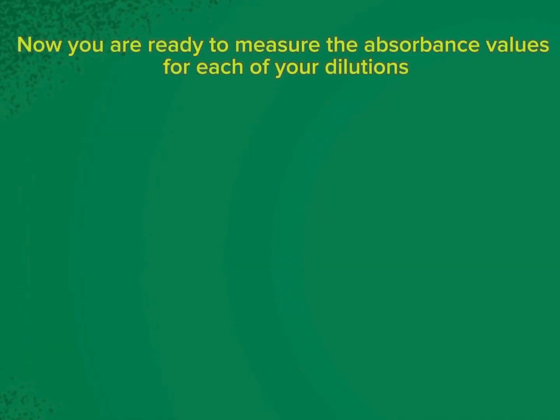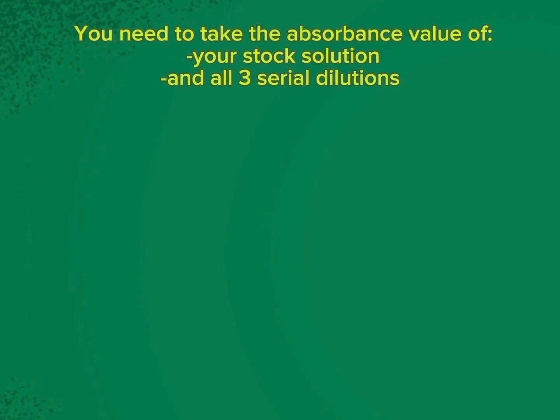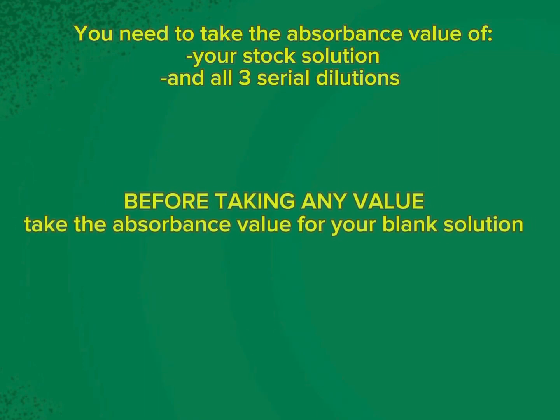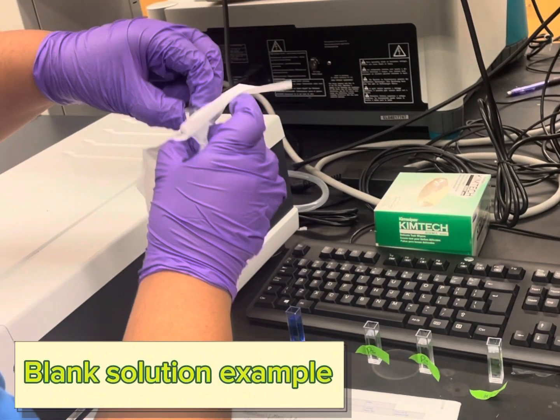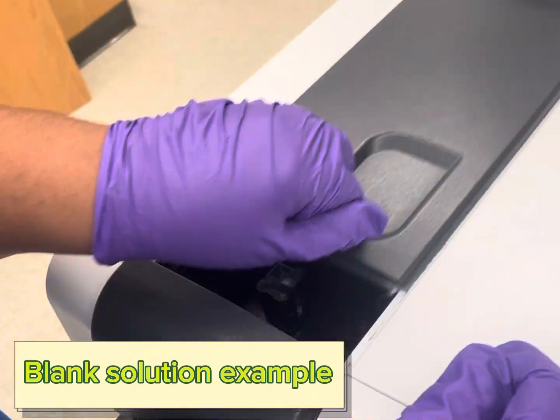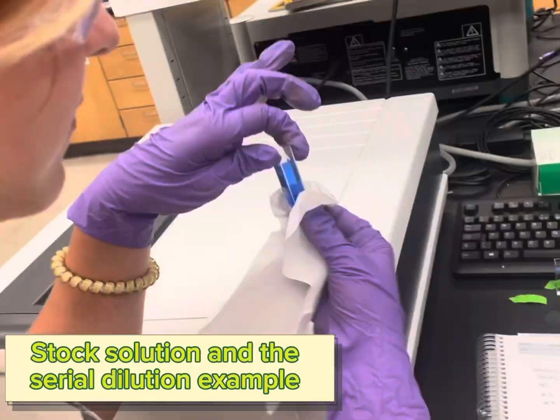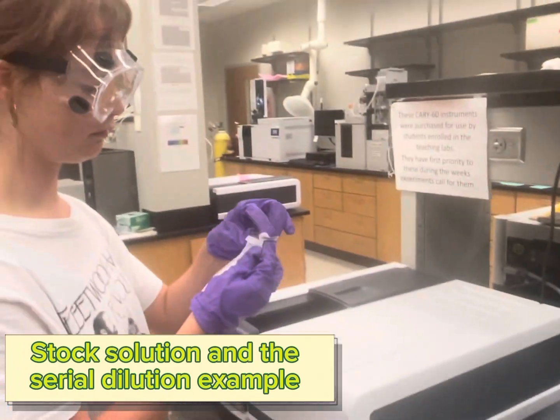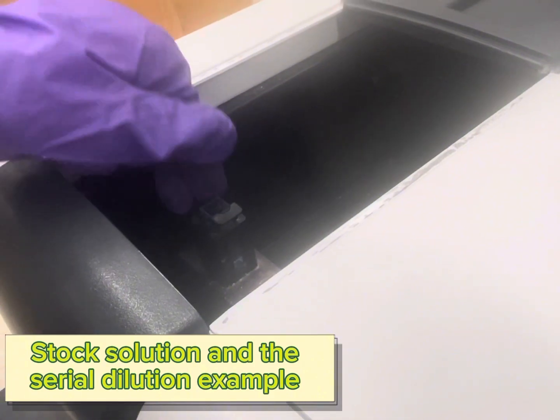Now you are ready to actually measure the absorbance values of each solution. To do this, you use a different program, but you use the exact same steps as before. Don't forget you need to take the absorbance value of your stock solution as well as your dilutions, and before everything else, test your blank solution as a reference. Be sure to set your wavelength to your lambda max and follow the exact same steps as before, with wiping down your cuvette, opening the machine, and closing the machine. Again, repeat for all of your dilutions and your stock solution.